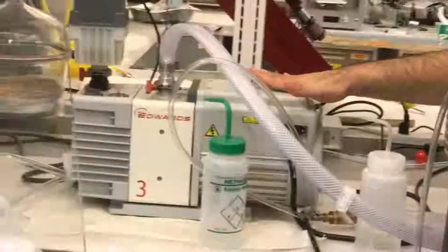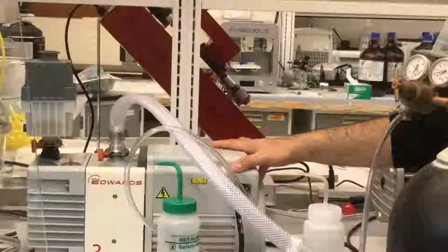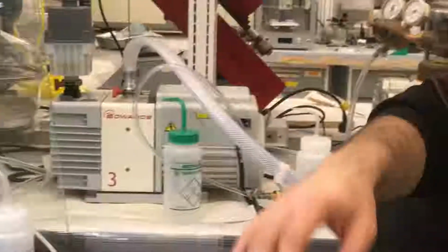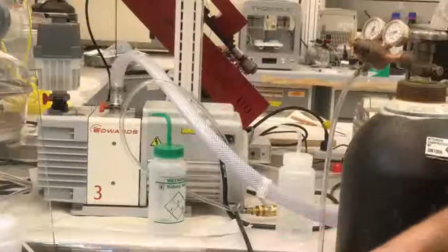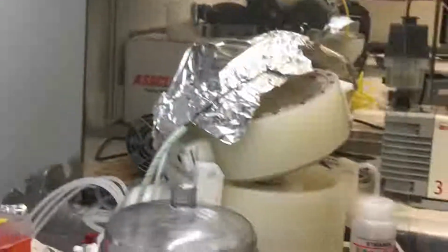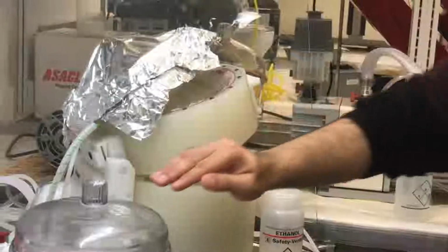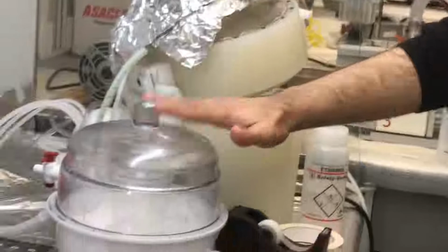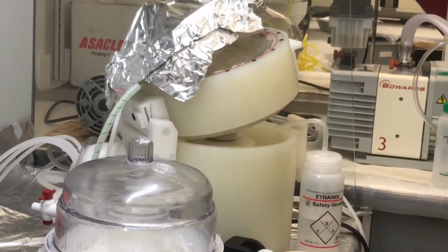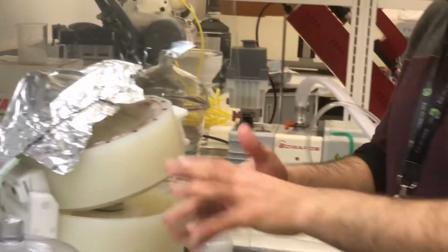So for this reason, do not use this pump at all more than 45 minutes, and do not leave anything inside and go outside, do whatever you want, and then come back. This is totally wrong, and nobody should do this. Whenever something is in the vacuum, you have to be there, because you don't know what's going on. Maybe the pump has stopped, maybe the vacuum had some issue, maybe the amount that you put in the cup has spilled. In other words, never leave this pump unattended. Exactly. You just stay here, or ask someone else to come and just watch it.